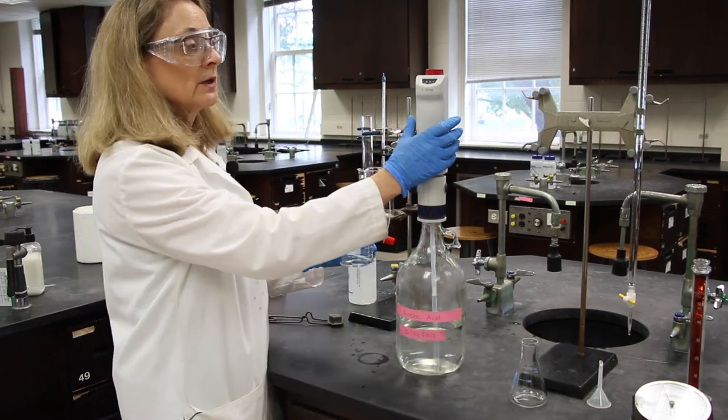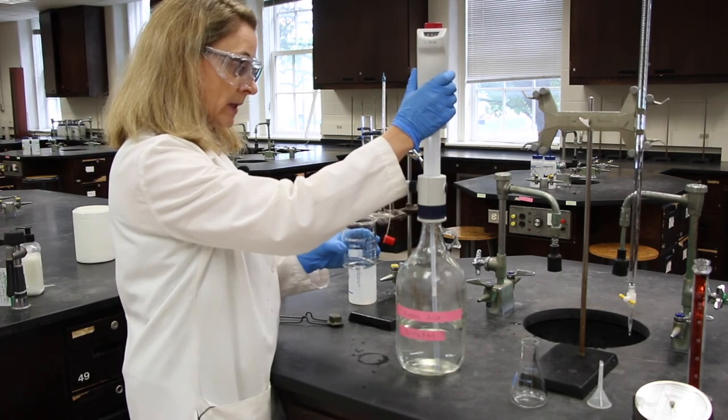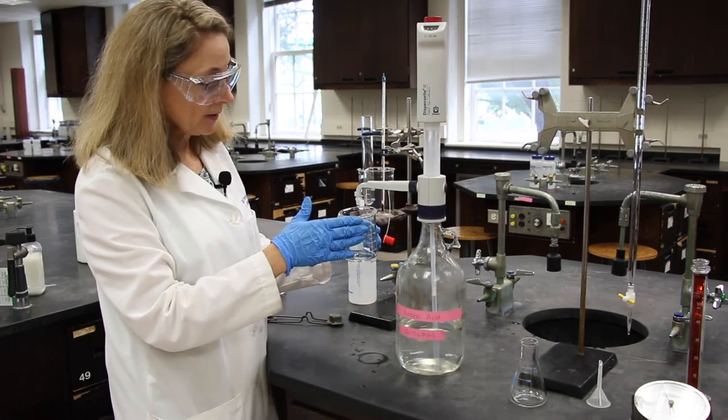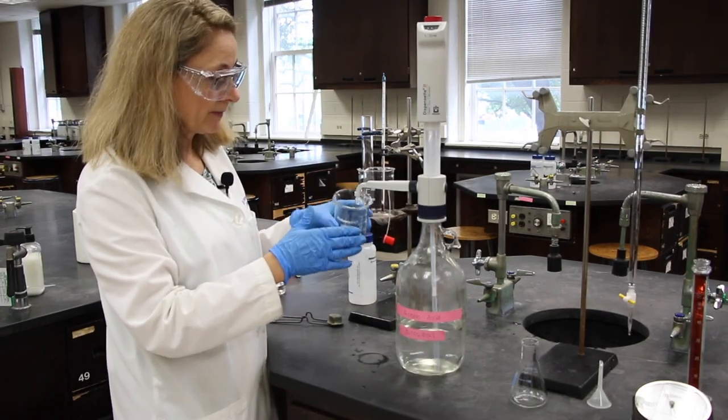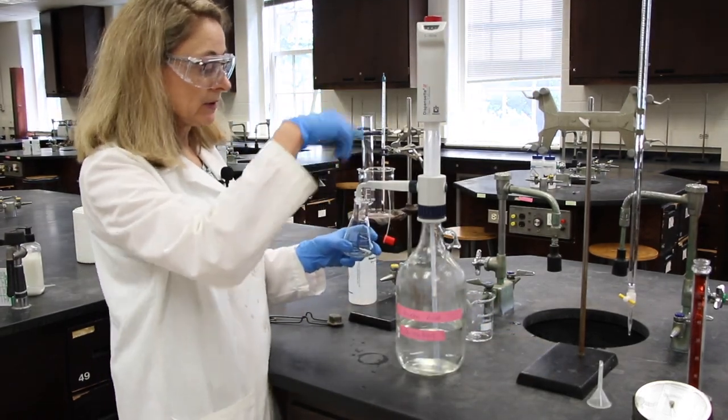You'll gently lift up on the barrel. Sometimes a drop of waste will come here and that will go in your waste beaker.